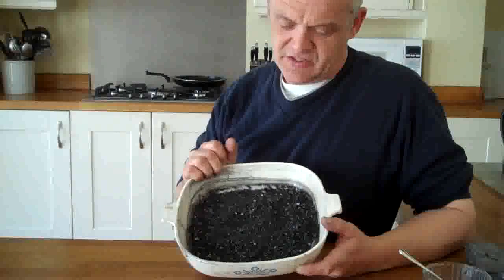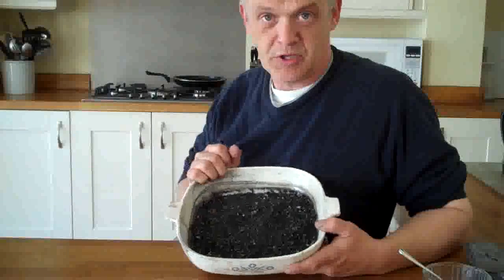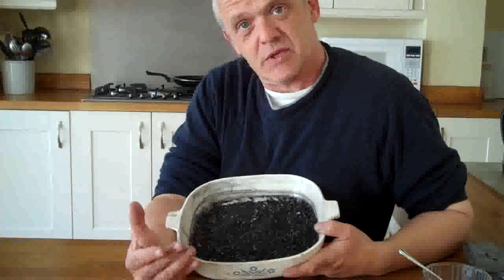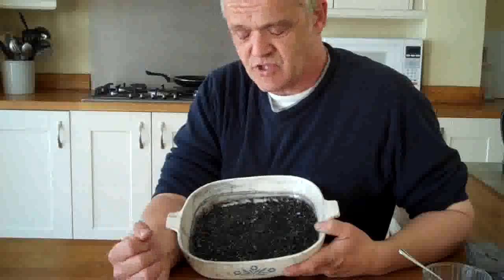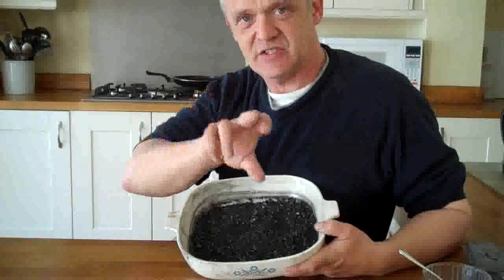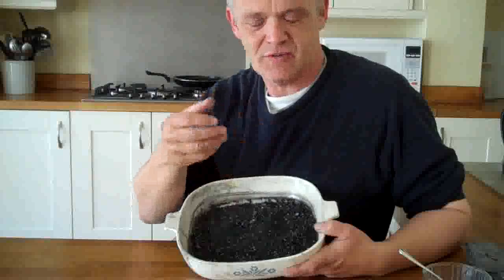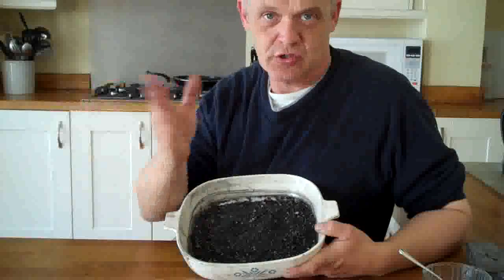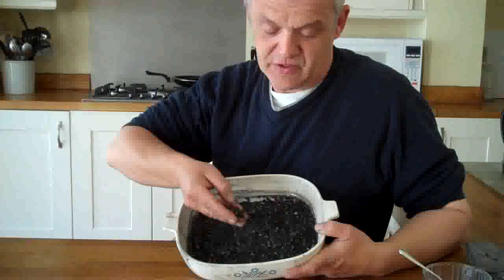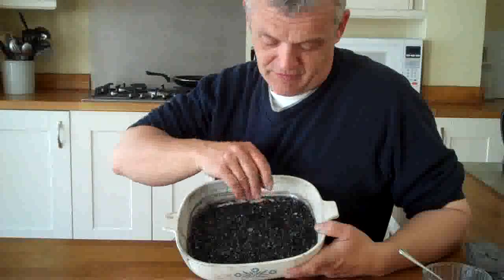So, as I said, I used the basic Hummers method, but I put in, if you like, too much graphite. So instead of putting in a gram or two, I put in 50 grams, and instead of keeping it at 25-30 degrees, I kept it at 10 degrees. It doesn't mix then, it forms a separation. You have a layer of concentrated acid and then a layer of graphite at the bottom, and you stir it every now and then. At the end of 5 days, you chuck the whole lot in some water, and what you get after you've washed and dried it is this granular silvery graphite.